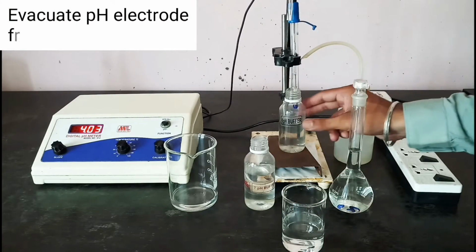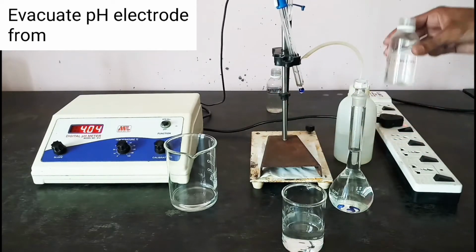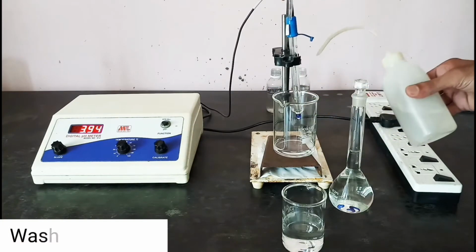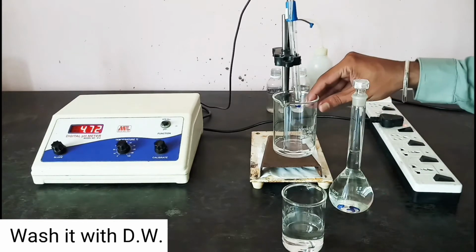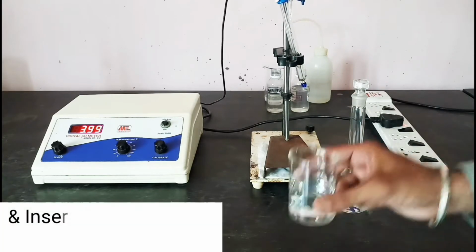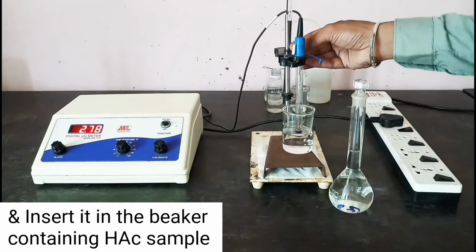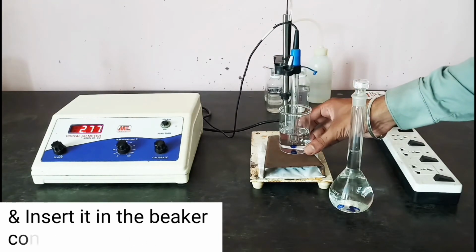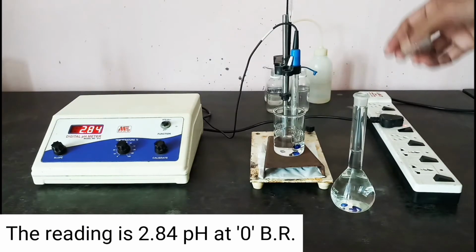Evacuate the pH electrode from 4 pH buffer. Wash it with distilled water and insert it in the beaker containing the acetic acid sample. The reading is 2.84 pH at 0 burette reading.